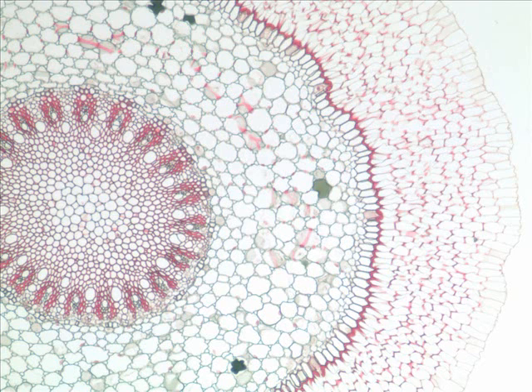All right, ladies and gentlemen, back up to the beginning. And is this a monocot or dicot? Are orchids monocots or dicots? Based on your observation there, what? They are, of course, monocots. End of story. All right, bye bye.